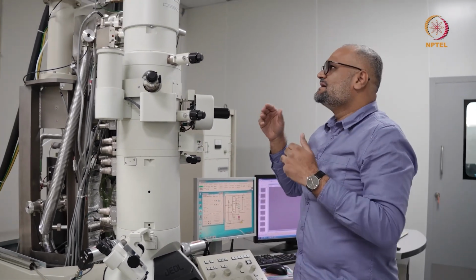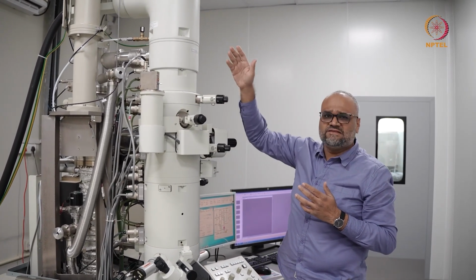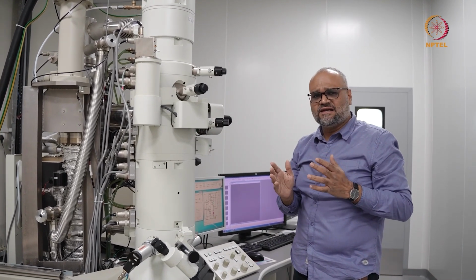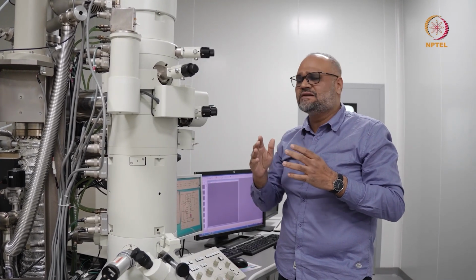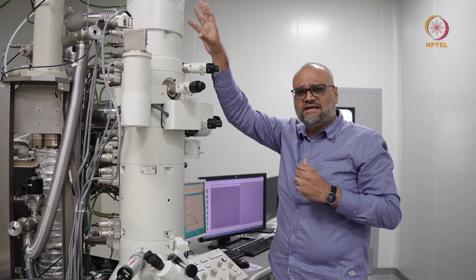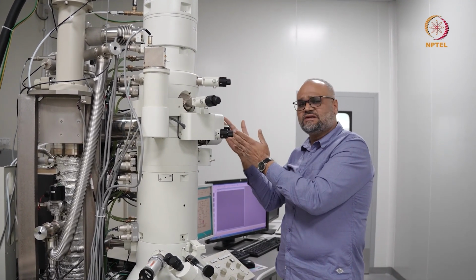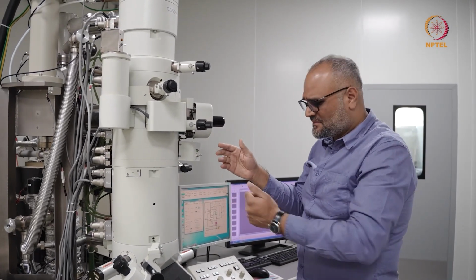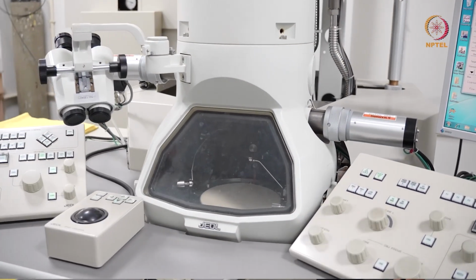When you start imaging, you start by aligning the microscope, starting with each of these individual components in this particular sequence. It is not a hard and fast rule that you always stick to the sequence, but it is a healthy practice and it is easy to remember if you start by aligning your emission system, condenser aperture, and then you load a specimen over here, you adjust the specimen height, and then you start imaging. Once you start imaging, you record the data over here. You see the data on the fluorescent screen as you see here.